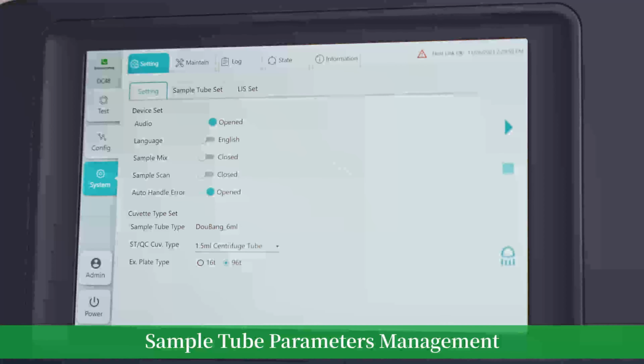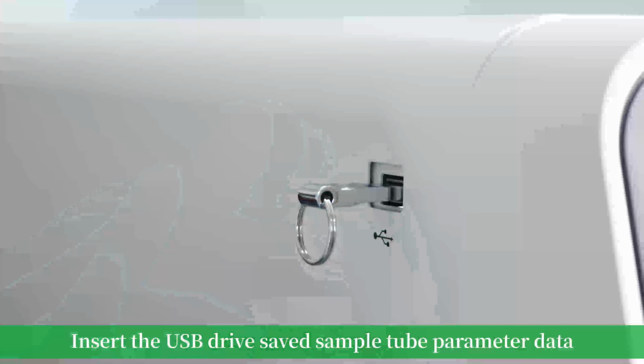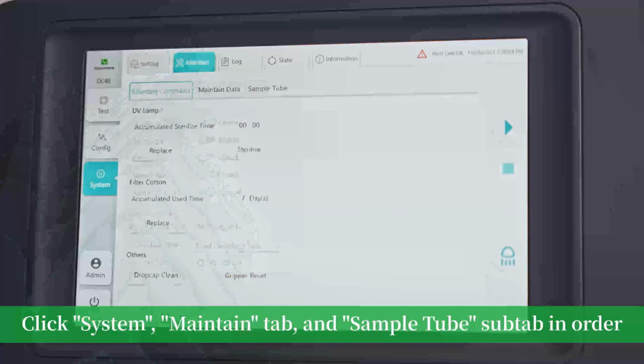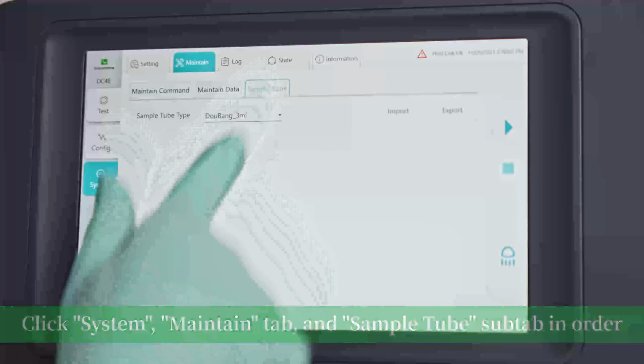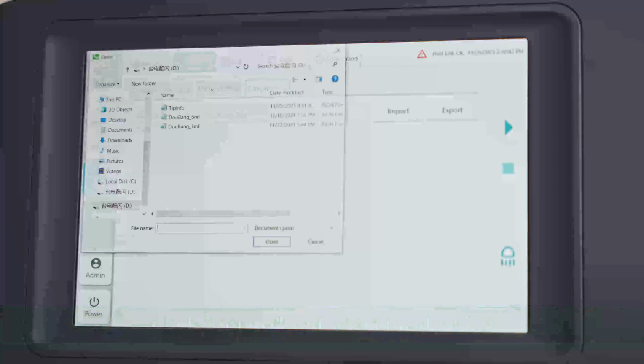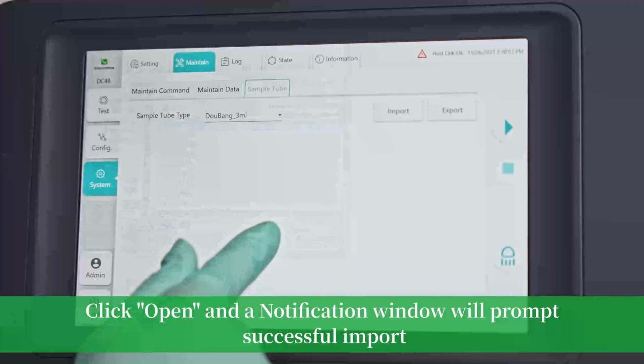Sample tube parameters management. Insert the USB drive saved with the sample tube's parameter data. Click System, Maintain tab, and Sample tube subtab in order. Click Import and select the data file. Click Open, and a notification window will prompt successful import.